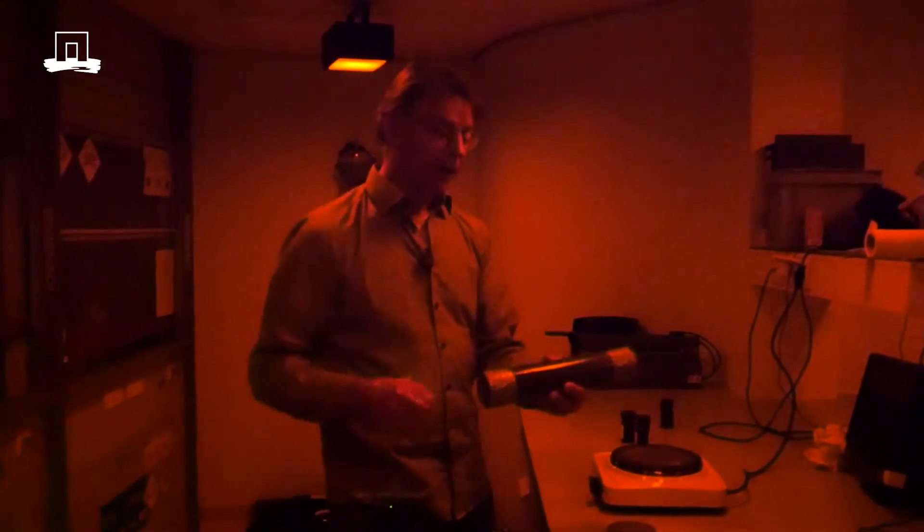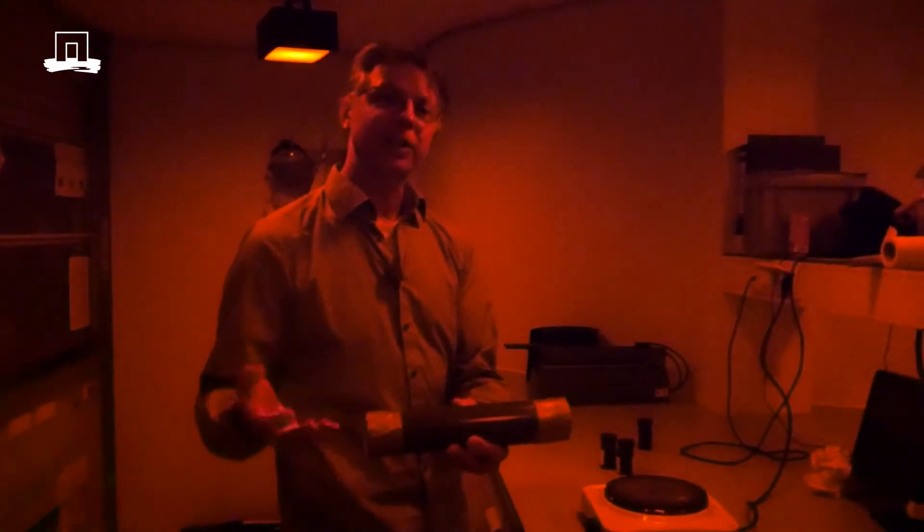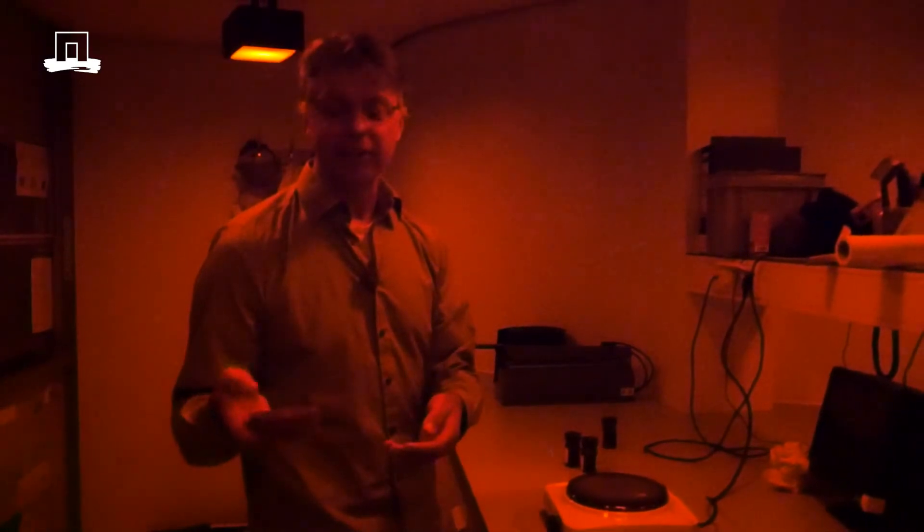To do that we first need a sample, which we normally get in a tube like this, hammered into an exposure. In the lab we split this sample into a portion that was light-exposed from the outer ends of the tube, and a portion that never saw light from the inside of the tube. The outer ends we use to measure how radioactive the environment is, by mixing some of the sediment with wax, making a puck like this, and measuring the natural radioactivity directly.